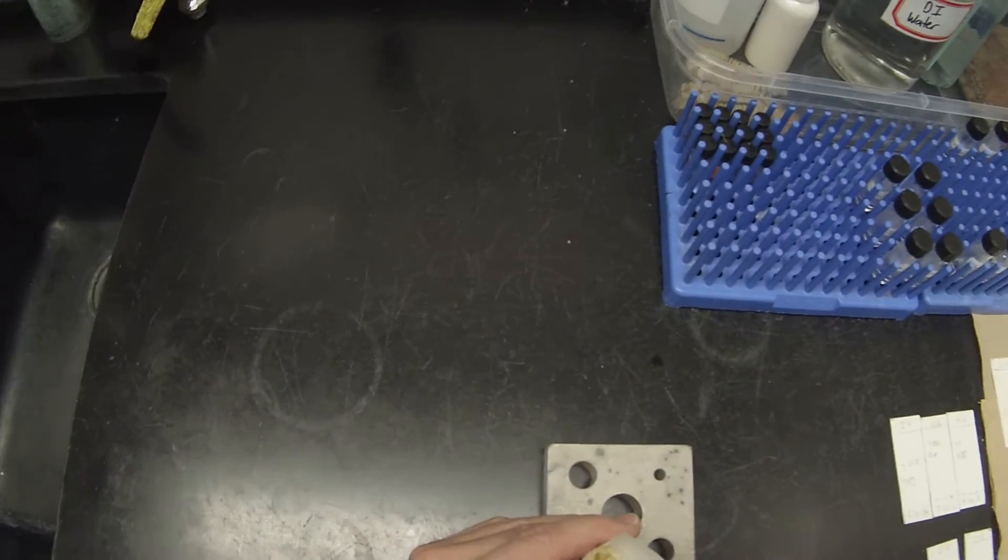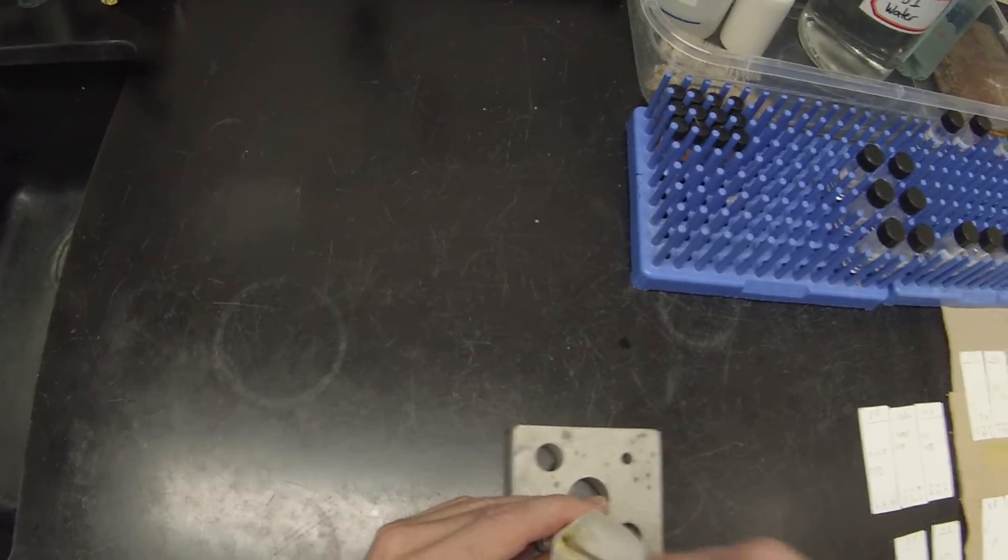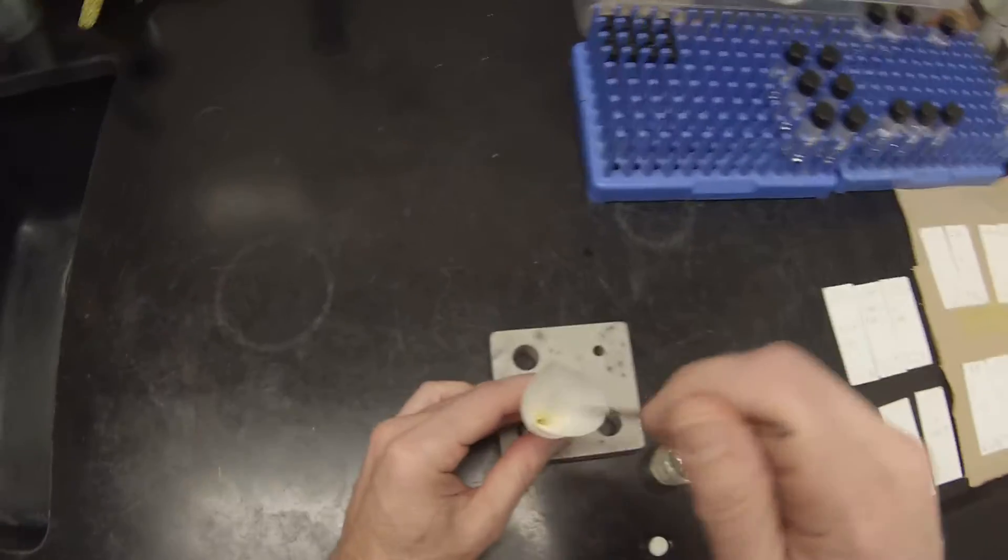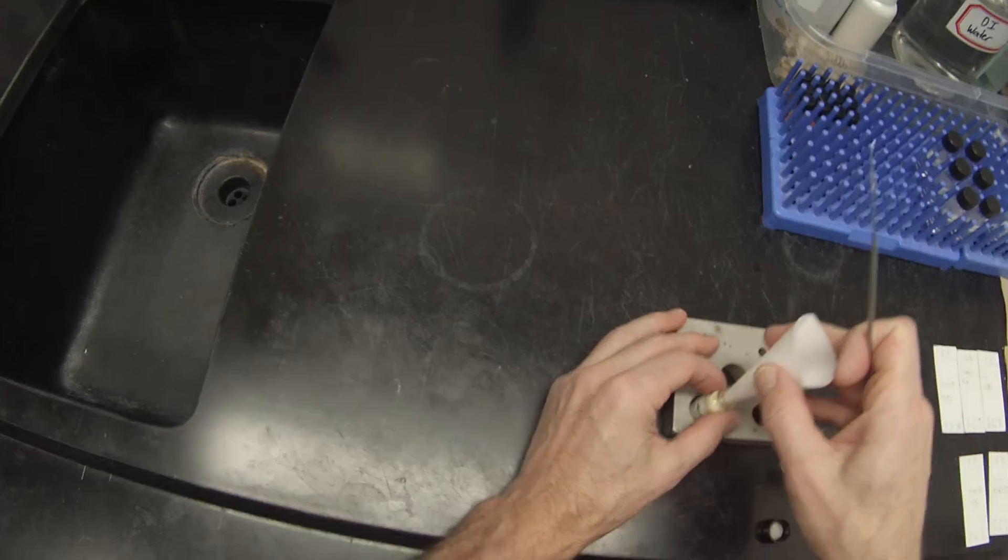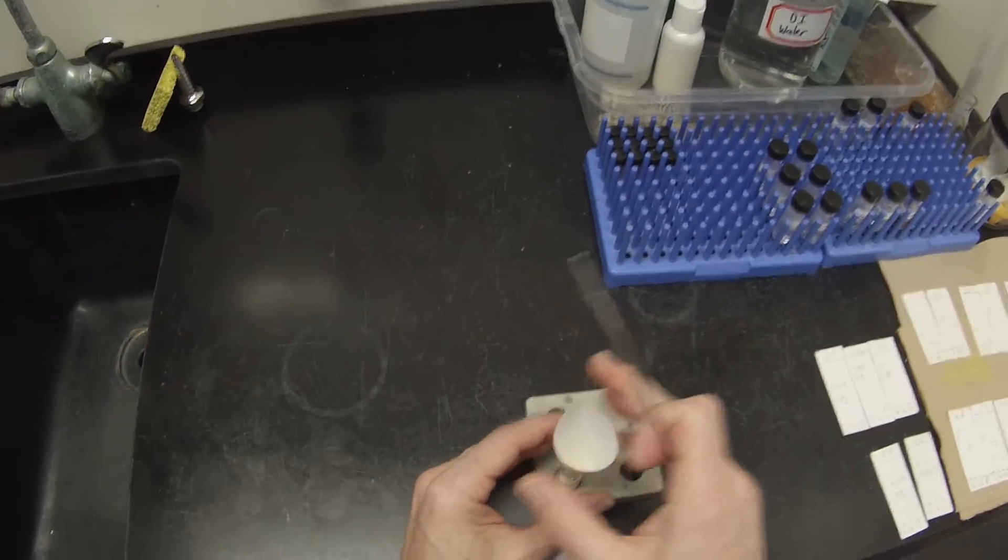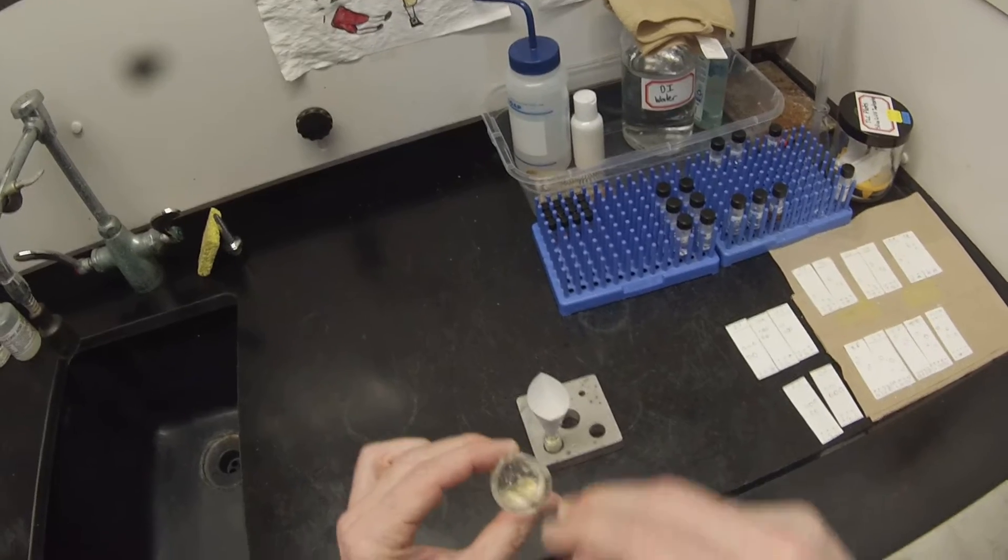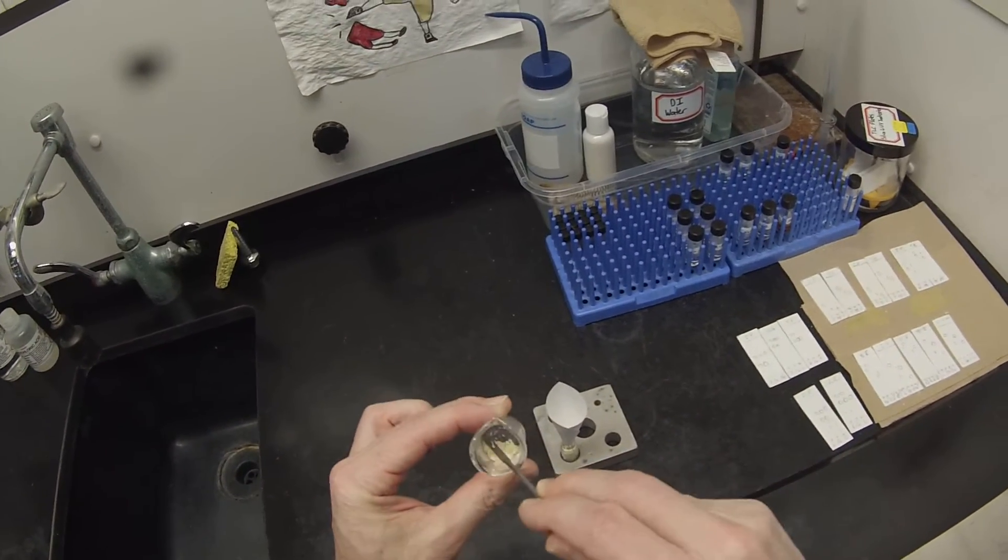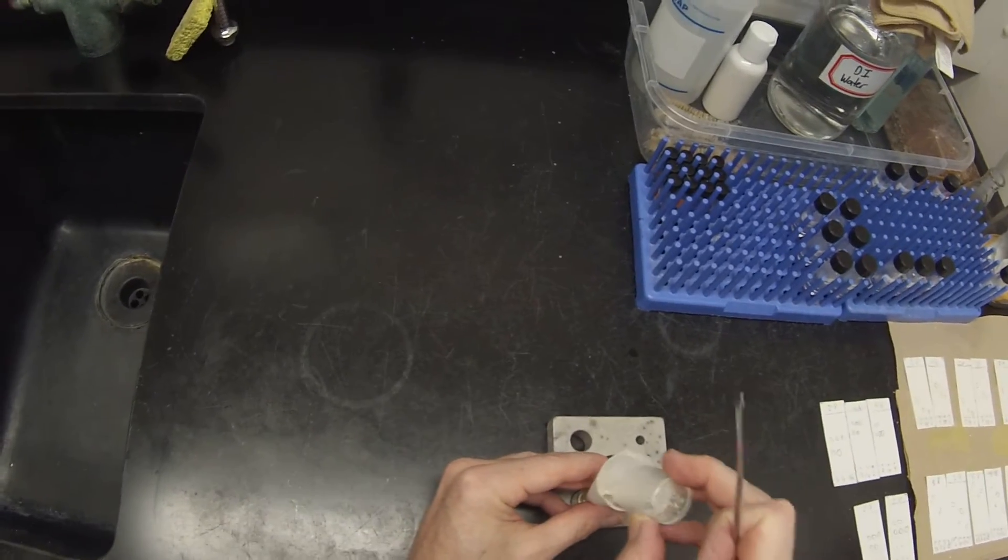I think it'll fit maybe, just about. Yeah, it's going to be tight. We should be able to pack that down enough to get it in there.